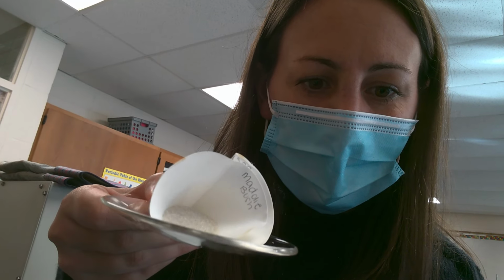Okay, guys, so this is a whole class's worth, but here is our dried sand, if you can see that. So the sand is stuck in the filter paper. So instead of taking the sand out and doing multiple transfers, we're just going to weigh the sand on the filter paper, which is why we had our empty filter paper weight before. We wanted to be able to subtract that.